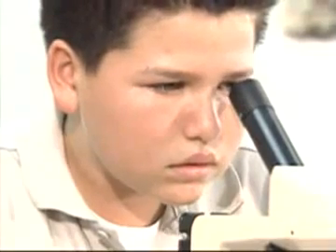As you can see, the inside of your mouth is made up of tiny uniform structures called cells. A cell is the basic unit of which all living things are composed. A person's entire body is made up of cells. Billions of cells that are not that much different from the ones that make up the organisms you find in a drop of water.